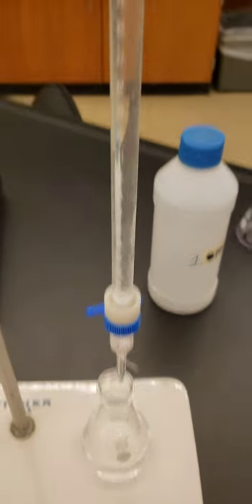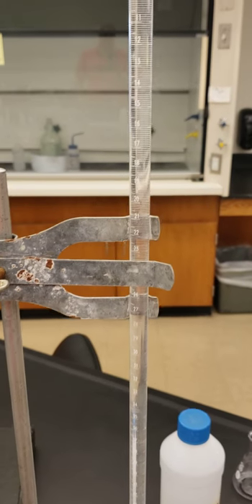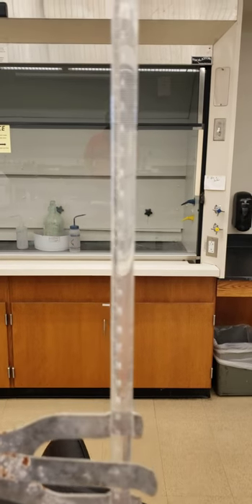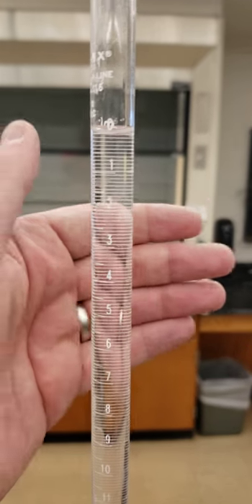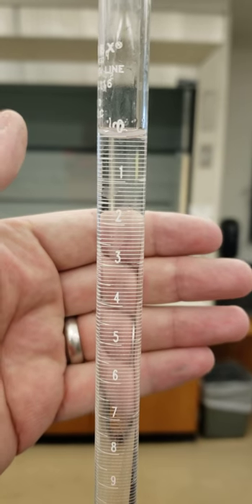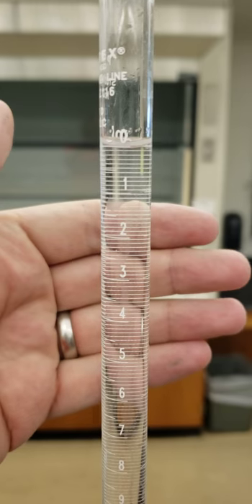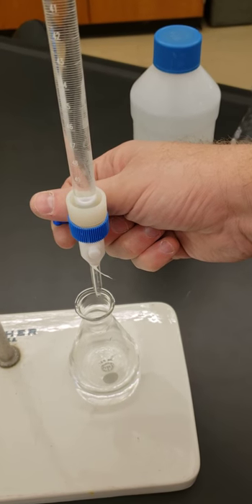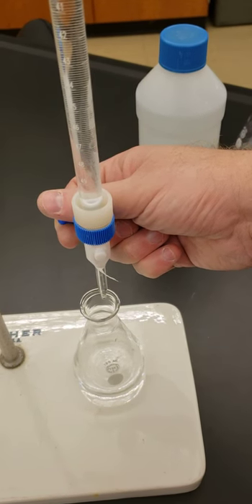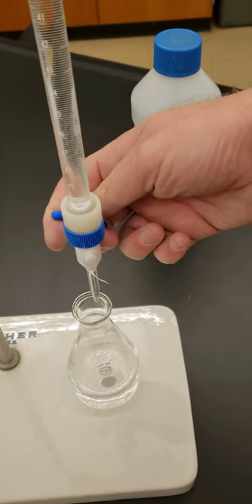As of last time, I have rinsed out the burette with deionized water twice and then filled it with my known, which in this case is one molar sodium hydroxide. As you can see, I filled it to 0.0, so like last time we're going to start a steady but slow stream of drops — you don't want to crank it too much.